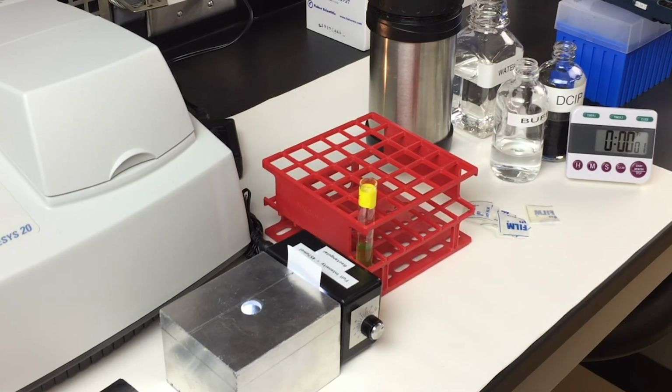Similarly, record your values of absorbance again in the table provided in your lab manual. Repeat the procedure until the absorbance reduces to 0 or almost to 0.